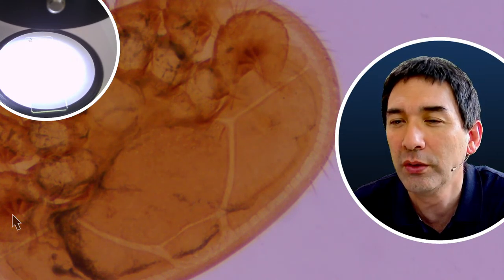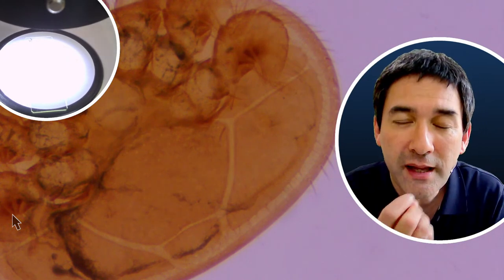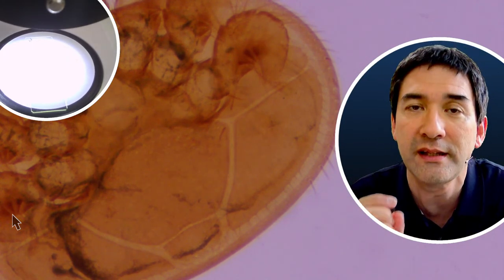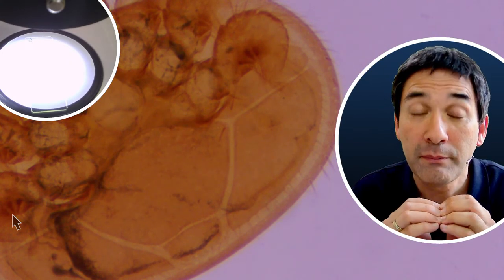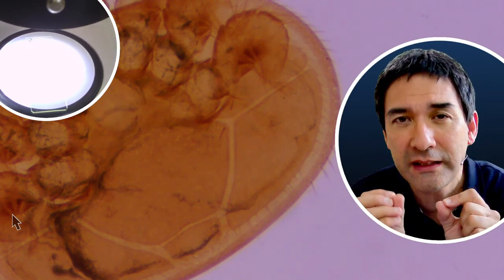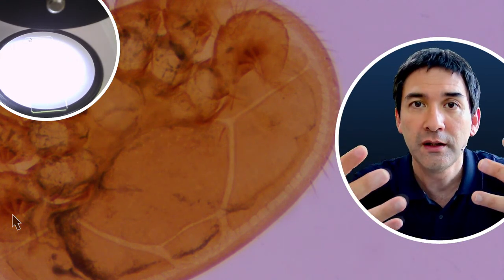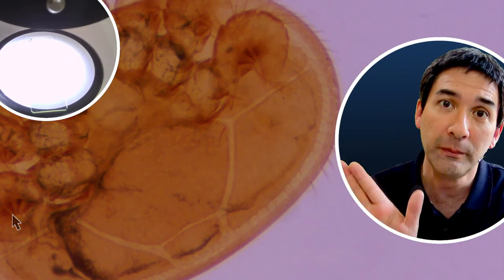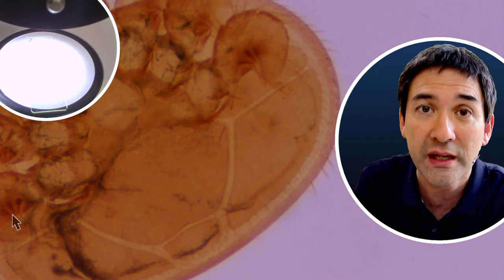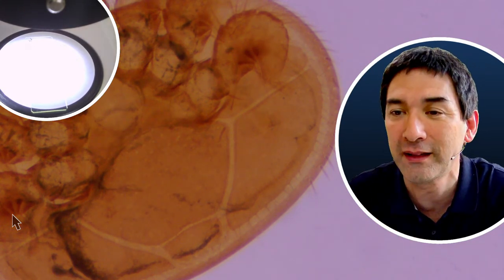Can you use an LED panel or old smartphone display to illuminate slides from the back? Yes, you can. If using a smartphone panel as an LED, put some paper over it so you don't see the pixels so much. The problem with some LED panels is you can sometimes see the individual LED lights, especially photography lighting panels. Panels designed for viewing film negatives or x-rays work better. One important thing: before you get an LED panel, make sure you're able to adjust the brightness — not all LED panels allow you to do that.